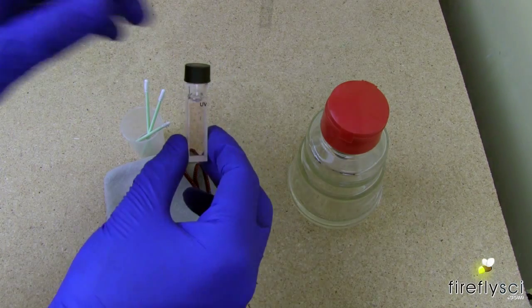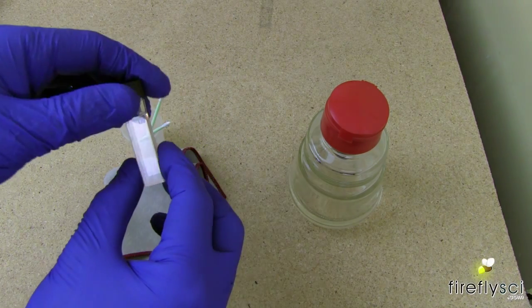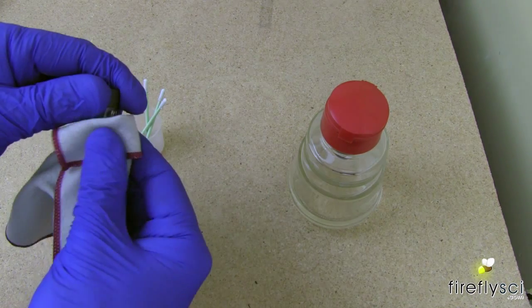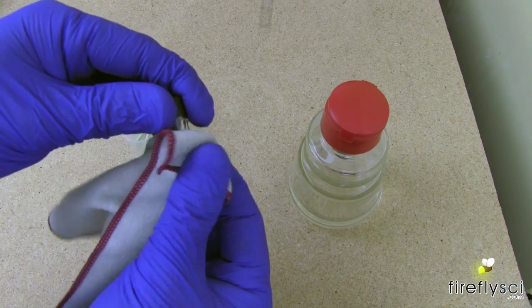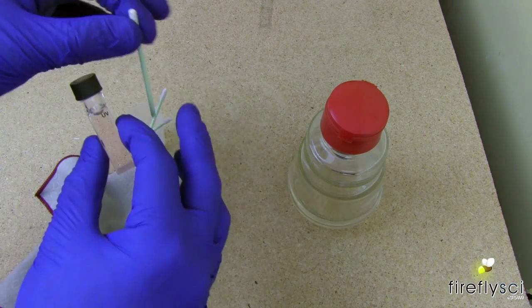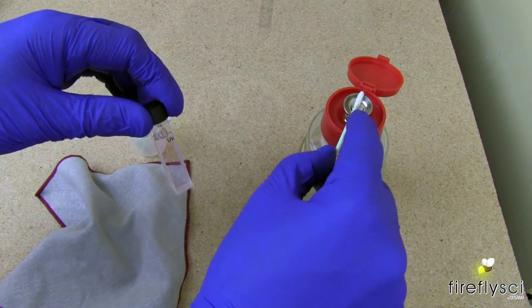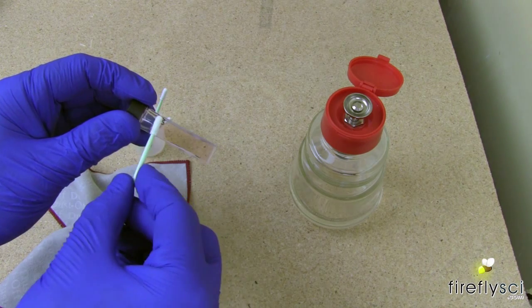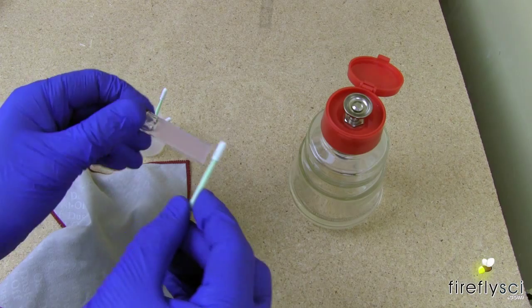These liquid filters are really easy to clean since they're housed in a 10mm cuvette. For cleaning, all you have to do is take a dust-free lens cloth or a kim wipe and just gently massage the outside just like this. If you do see anything on the outside, you'll want to move to taking one of the swabs from the alcohol, putting a little bit on here and just cleaning those windows just like that. You also want to do the back window.